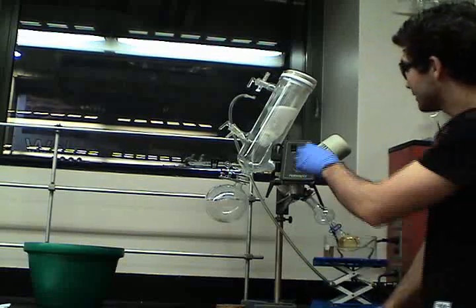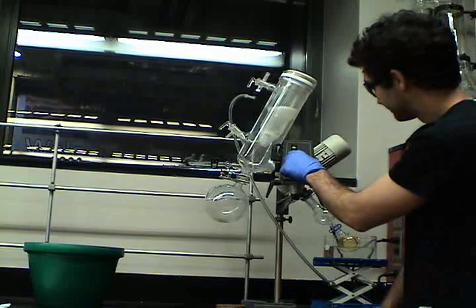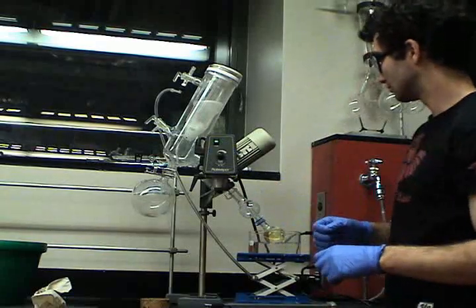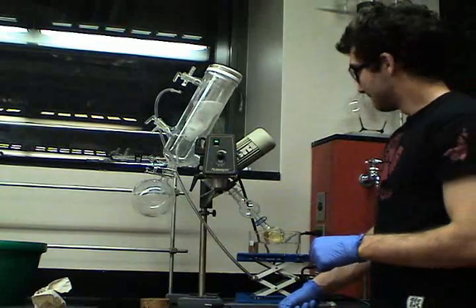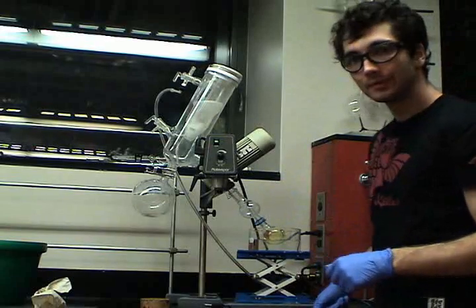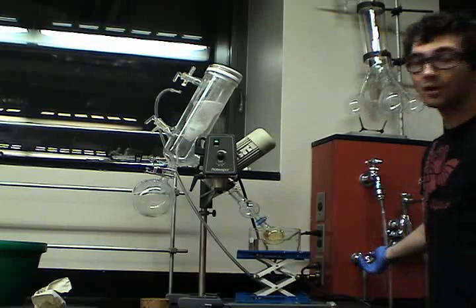Then, I'm going to start the rotor. Now that the rotor is going, and the glass is in the liquid, I can turn on the aspirator. Full blast.